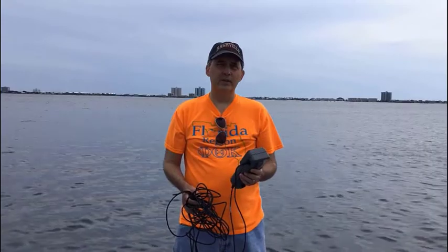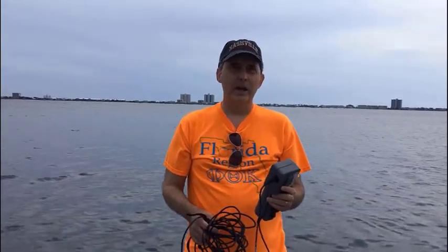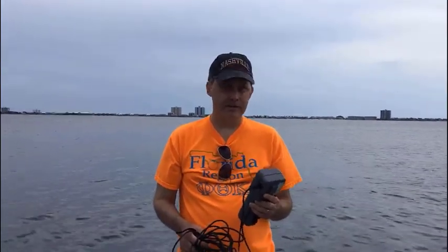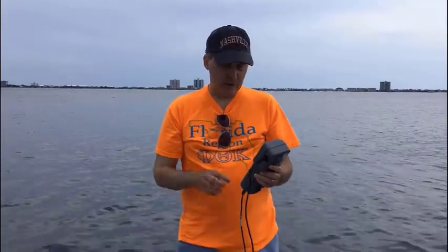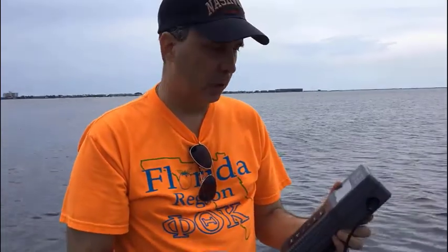Next we're going to use the dissolved oxygen meter to find out how much oxygen is in the water and also the water temperature. We had to input the salinity into this first — I went ahead and set it at 25 parts per thousand. To get started: turn it on, let it warm up, then press the two up-and-down buttons at the same time and hold for a second — that puts it in setup mode. I set the altitude at less than 100 feet, which is our altitude here. Then enter the salinity. It's all set and ready to go.